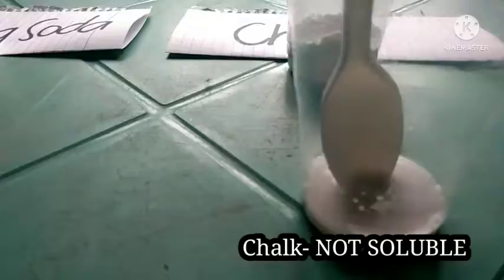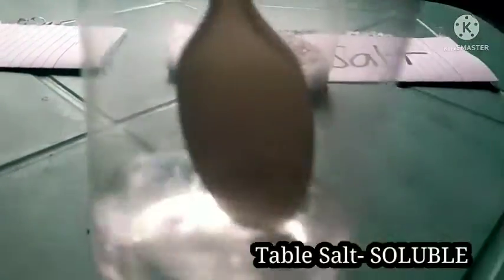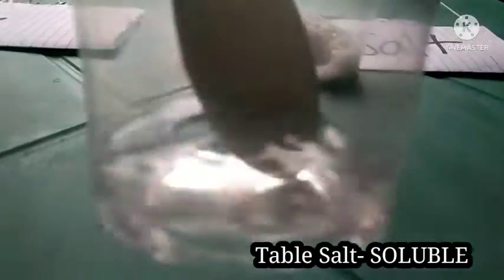Next is chalk or the calcium carbonate. Makikita naman natin na cloudy din siya. So, it is not soluble in water. And lastly, the table salt. Just like Epsom salt, it is clearly dissolved in water. So, table salt is also soluble in water.